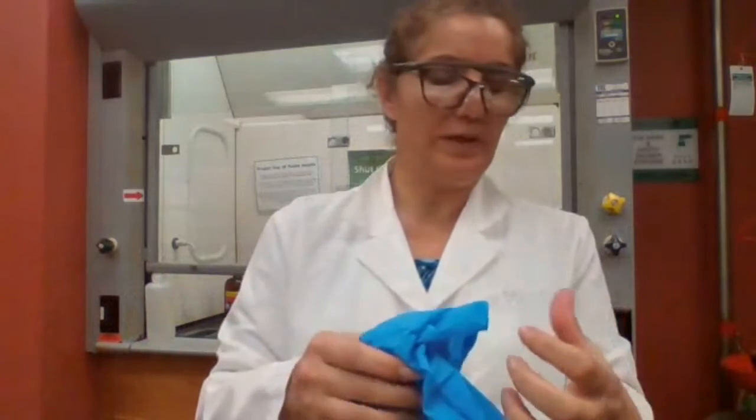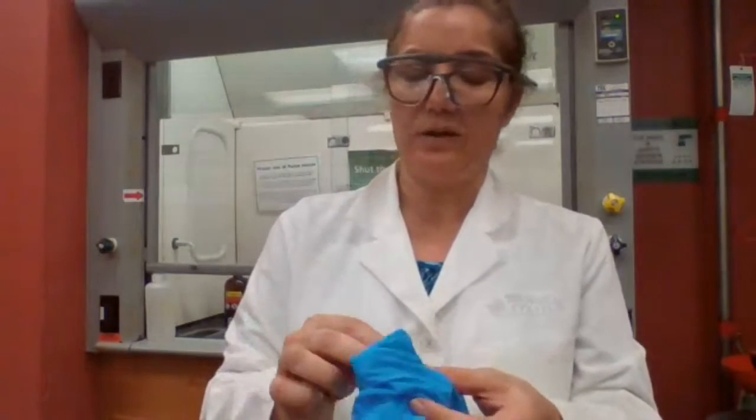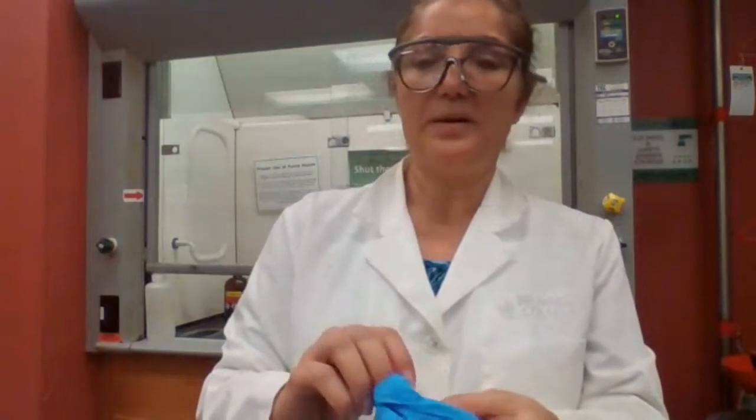No, I didn't test for the tertiary. We were only supposed to do the secondary alcohol, but I added the primary for comparison, to see the difference, as a point of reference. How would it look if there is no reaction? How would it look if there is a reaction?